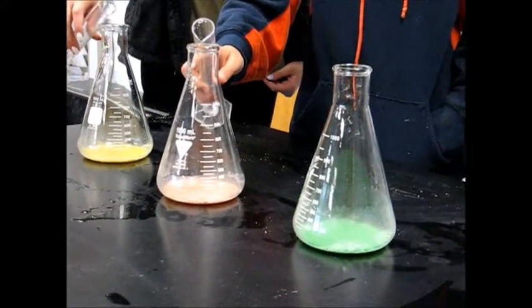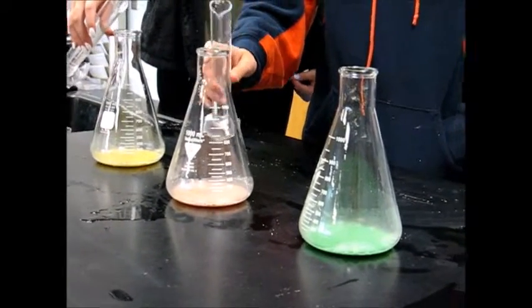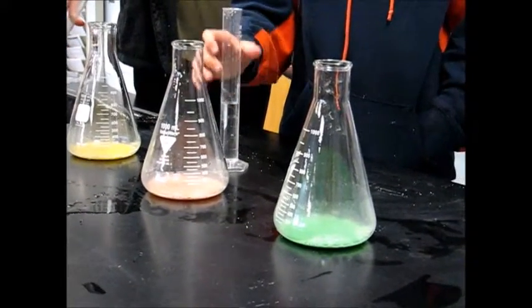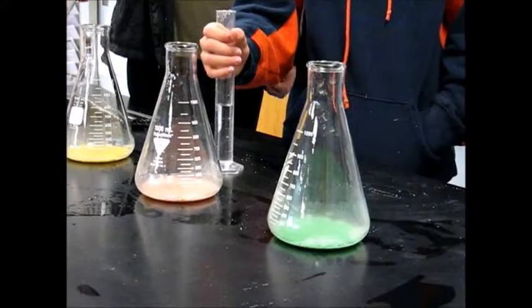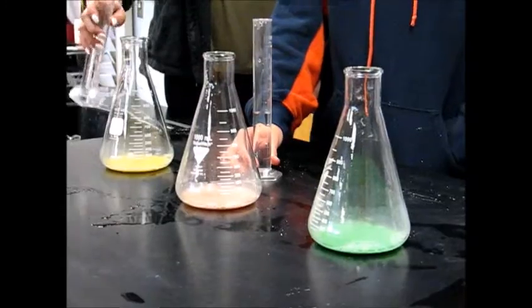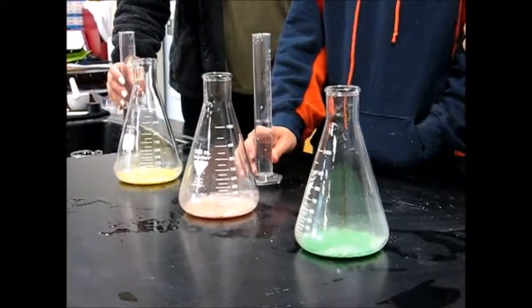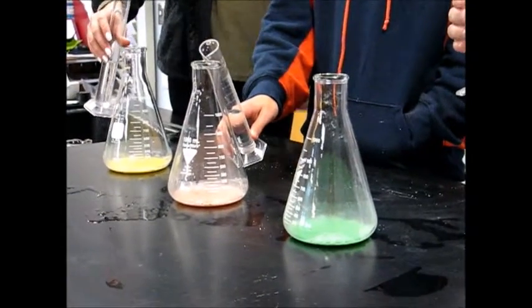Did you fill out on your sheets yet any of the information? No. What were the 3 concentrations of hydrogen peroxide? Emma, do you remember what yours is? 3. 3%. Do you remember what yours is? 12 and mine is 35. So write all the percents. What does the first question say? What are the concentrations? 35. What if you get 100%? That would be crazy. Okay, you ready?